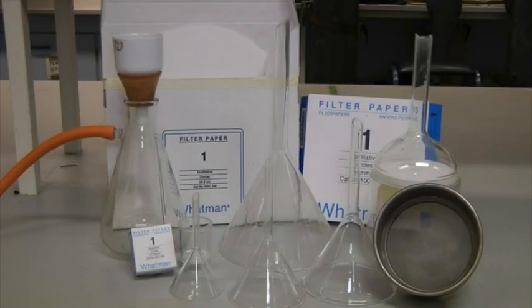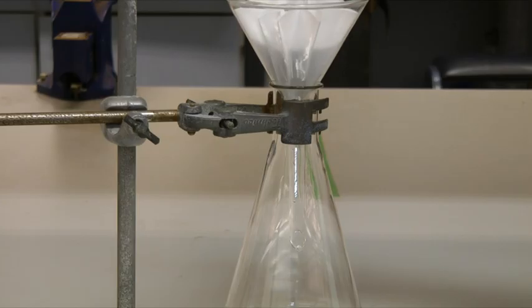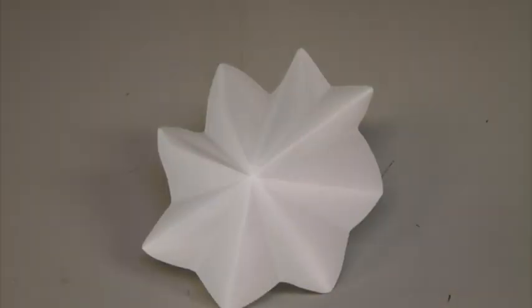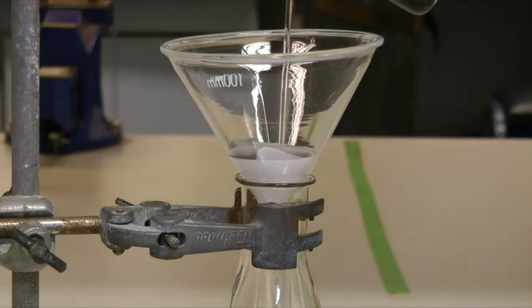Filtration is a technique for separating a liquid from an insoluble solid. A quick and efficient filtration requires a correctly folded filter paper. There are many ways of doing it wrong that might seem to work for a short while, but a solid often blocks the filter paper and slows the process down.